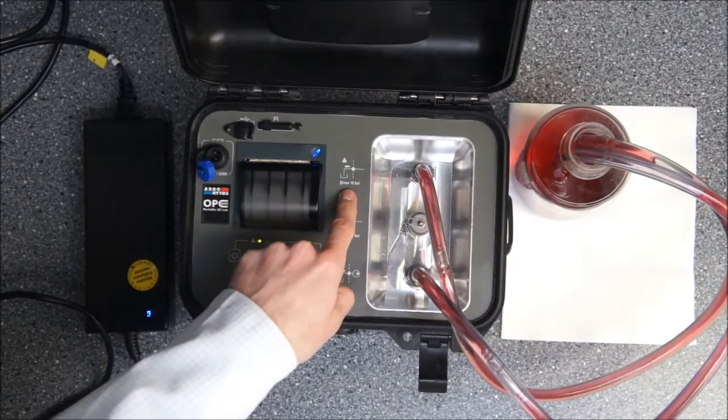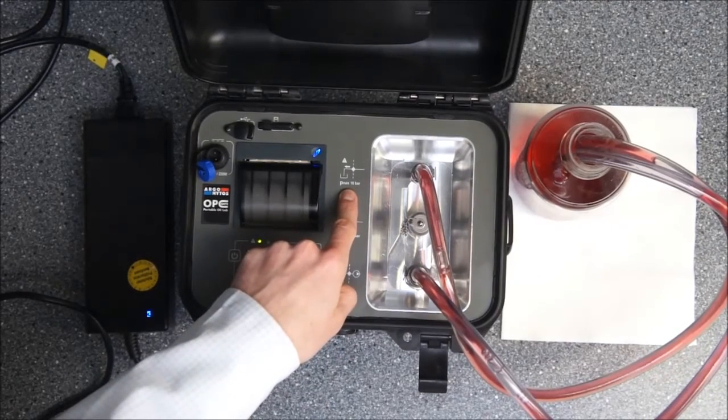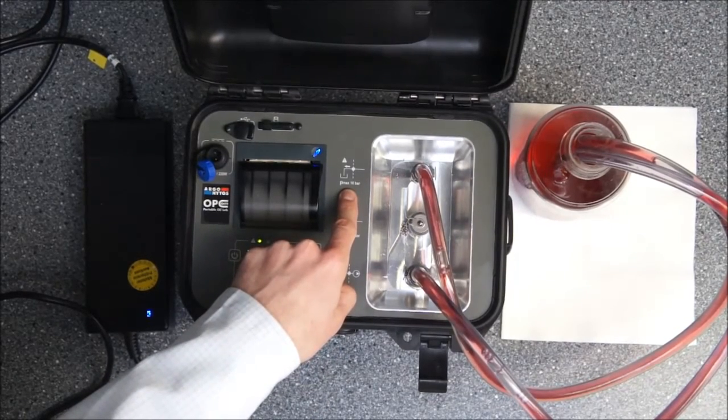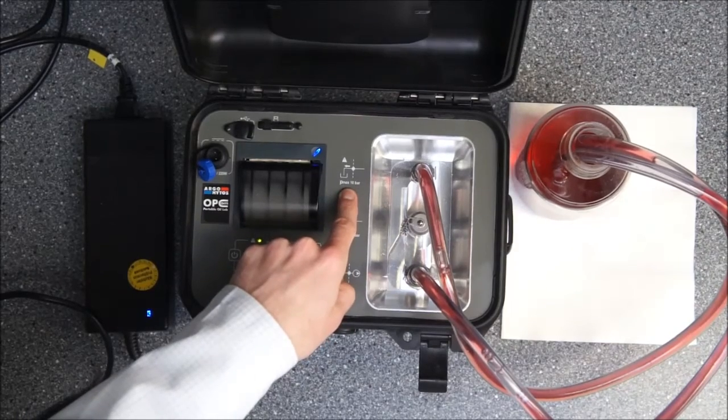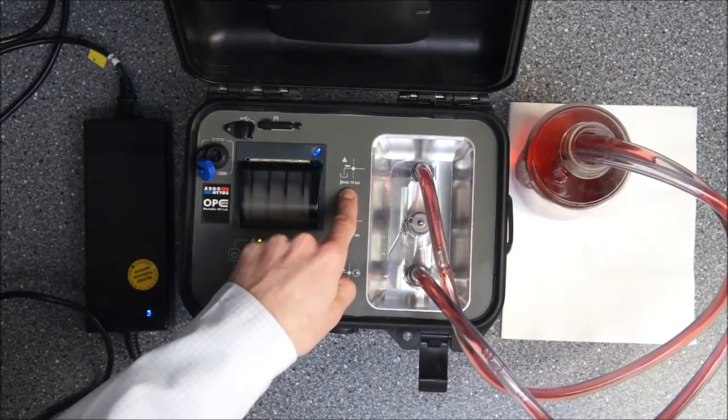On top you see the return line which can also pump the oil up to a back pressure of 10 bar back to the oil sample or reservoir.